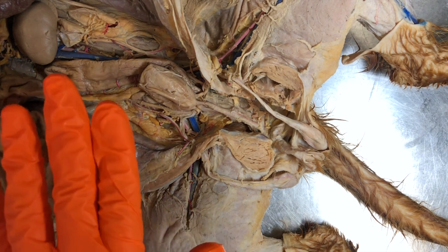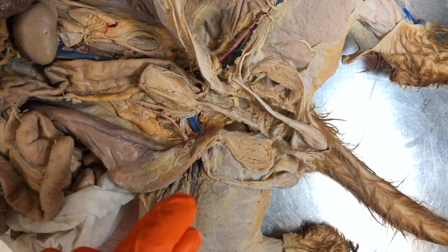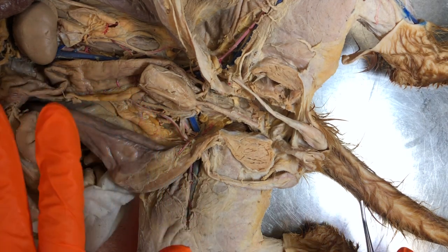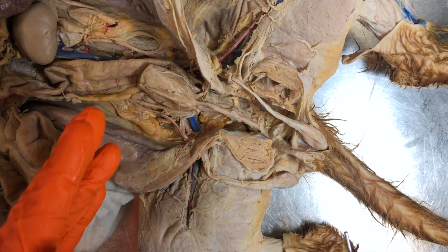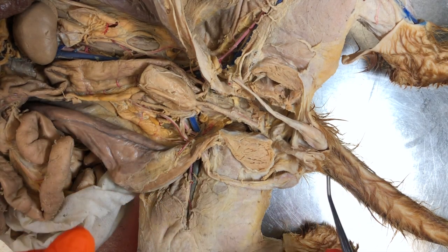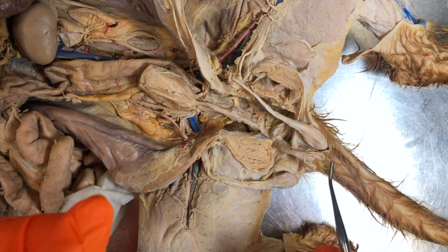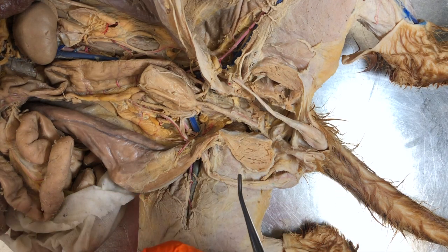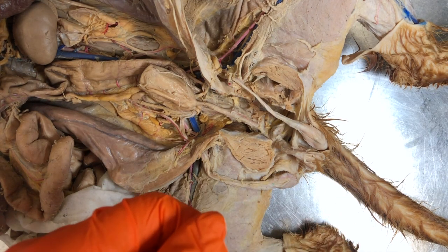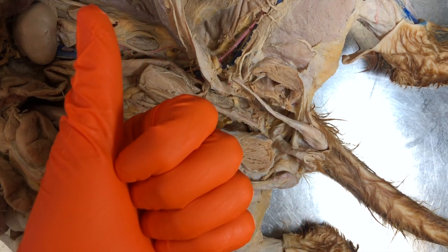That's all for the male reproductive organs on a feline specimen — pretty straightforward. Make sure you're reviewing these terms so you become well familiar with them, and then compare these structures with the models and pictures in our online resources.